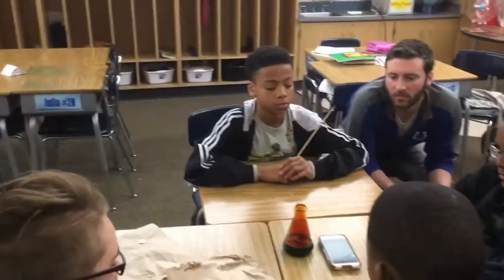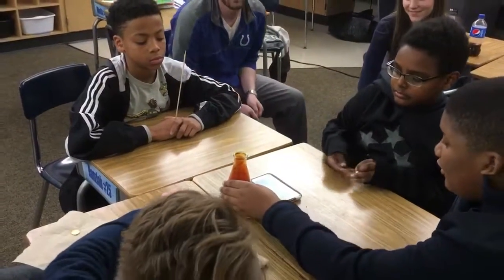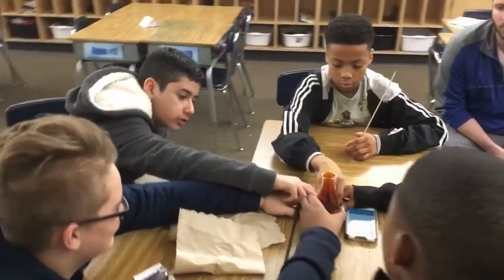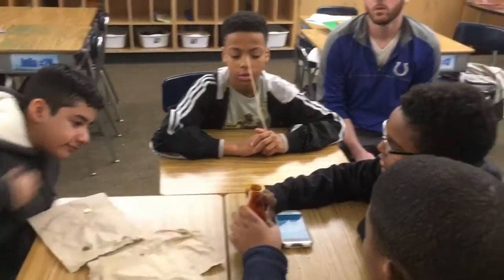It'll be completely gone. Now, this is an exothermic reaction, so I want you to touch the sides of the flask and tell me if it's warm. Because it wasn't hot when we started this, was it? No, it was a bit cold. So this reaction is exothermic, because it's releasing heat.